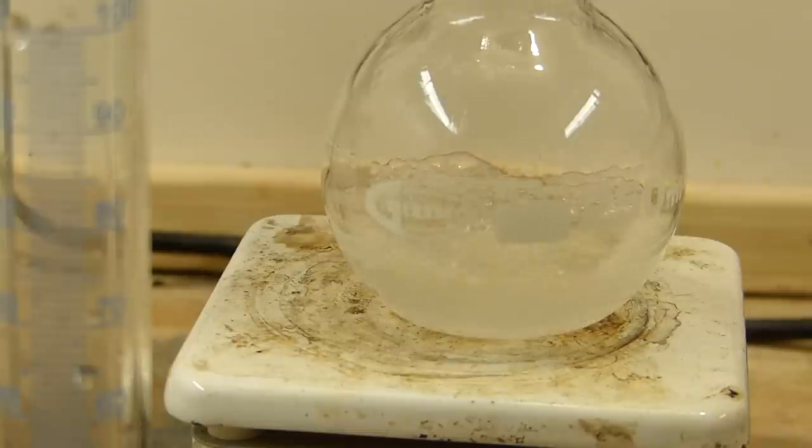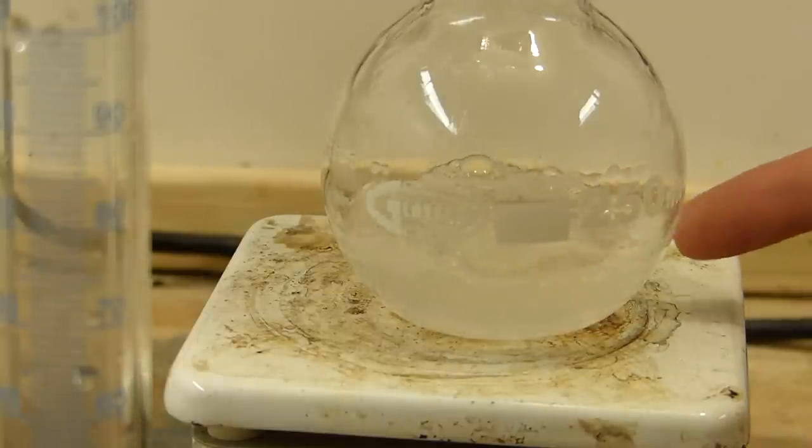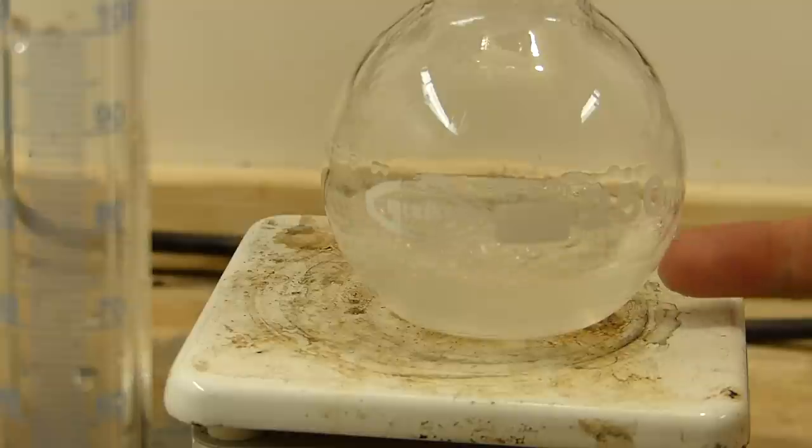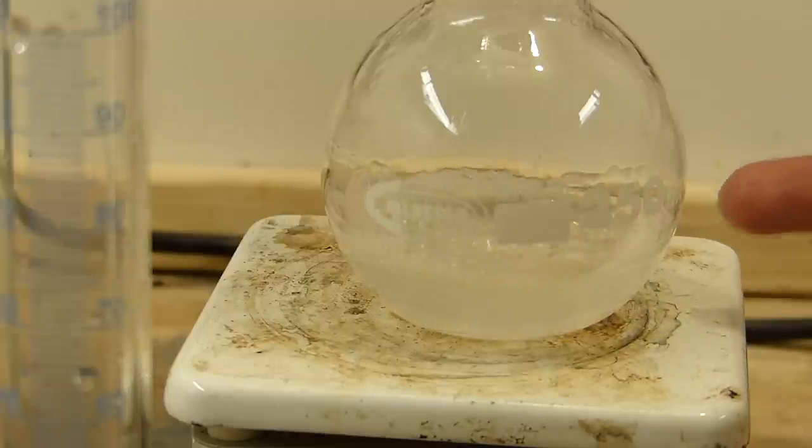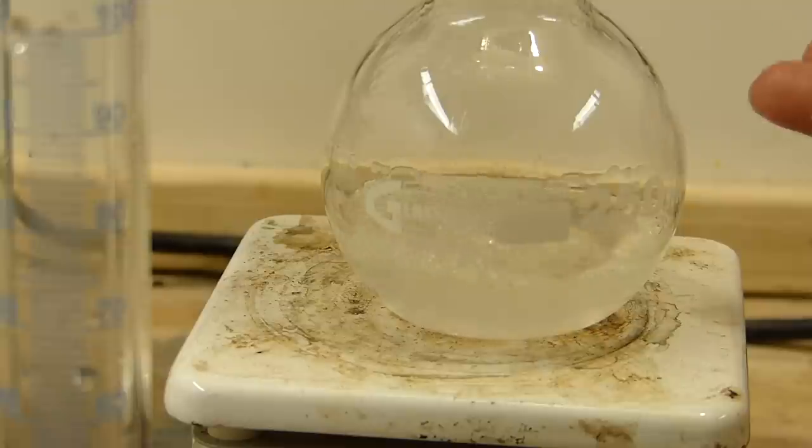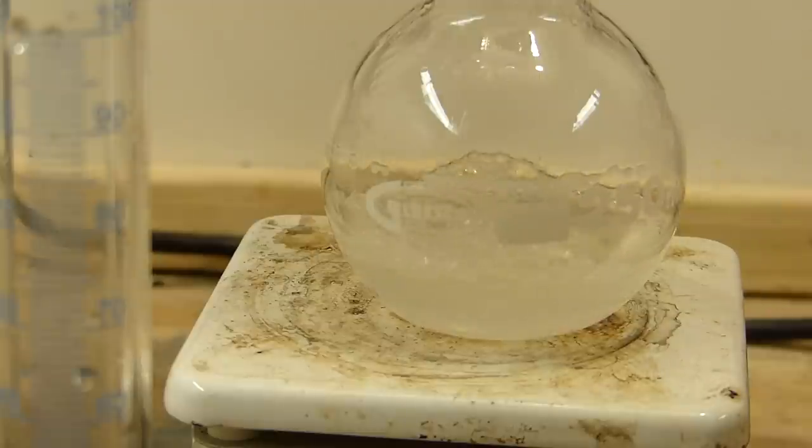Another benefit for choosing the reactants that I did is that this flask will be completely liquid by the time the reaction is done. When you cool it back down to room temperature, it's designed that with the solubility of sodium sulfate and the amount of water used, that it will not crystallize. So clean up is really easy. All you have to do is pour this flask out and give it a quick rinse.